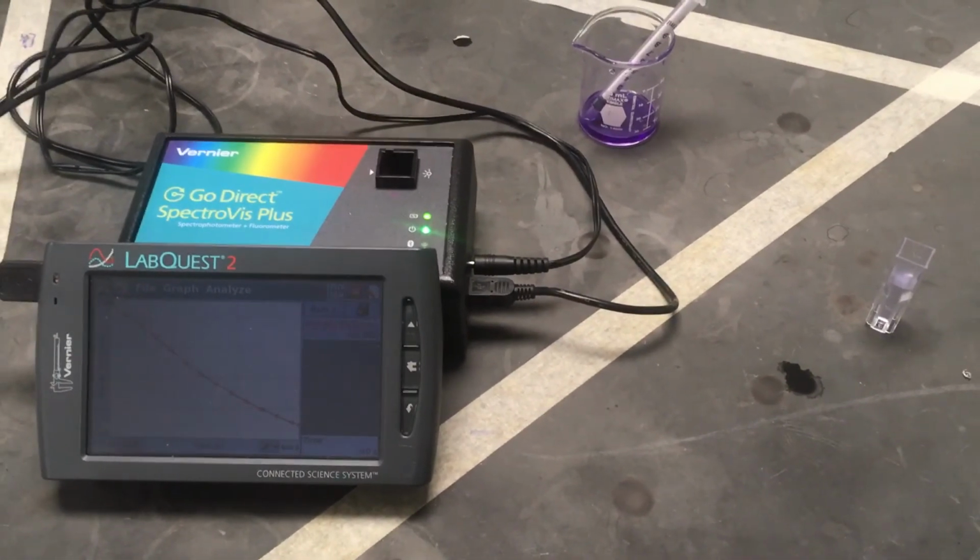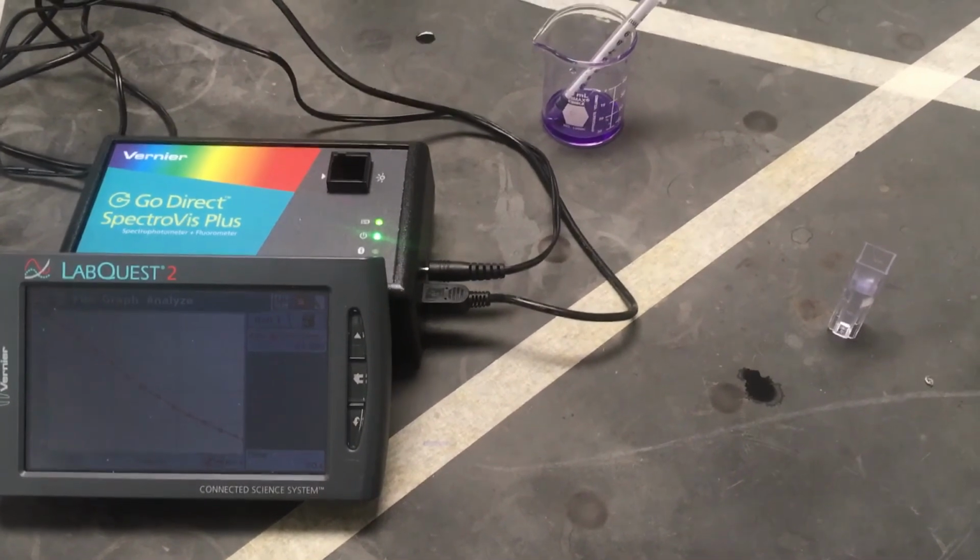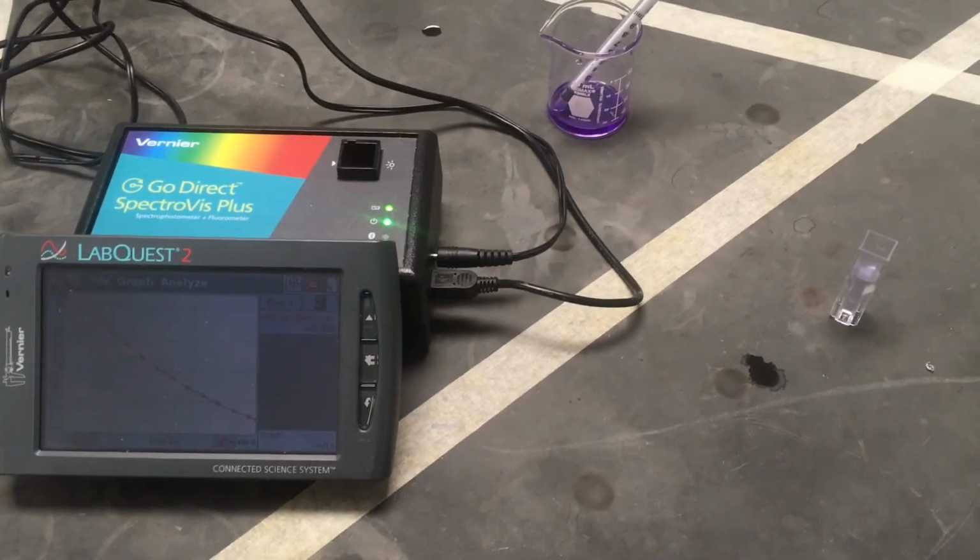We're going to have one last little clip that I'll pair with this as well. That's going to be taking a look at Excel and showing you all the data that you're going to be getting and what you're going to be doing with it.